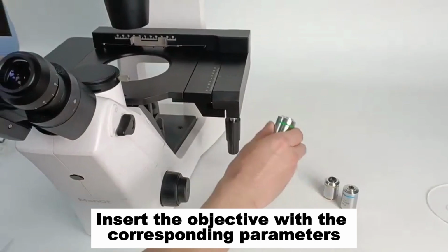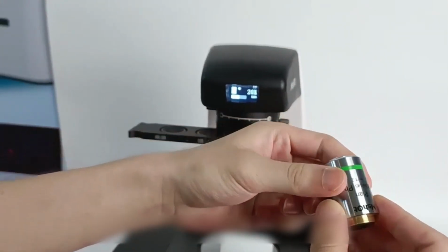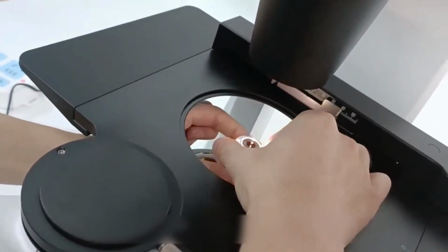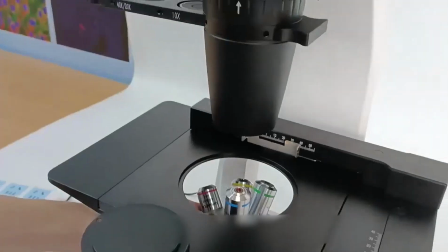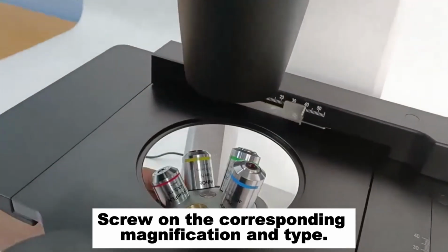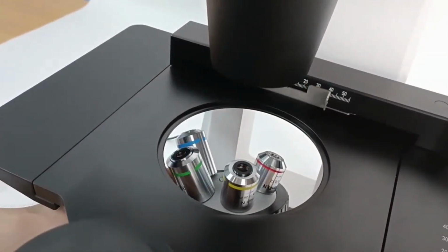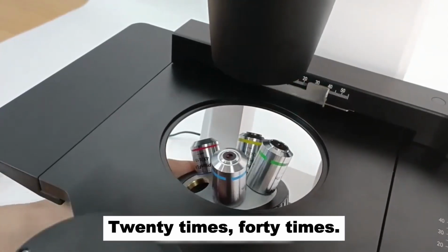Insert the objective with the corresponding parameters. Current hole position. Turn the objective turntable in turn. 10 times and 4 times bright field. 10 times, 20 times, 40 times.